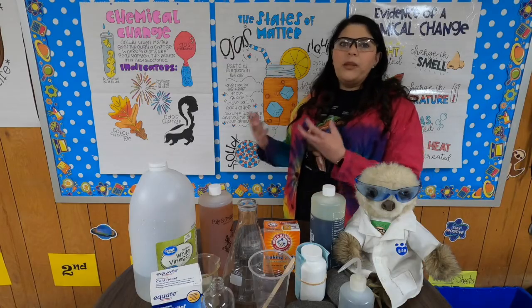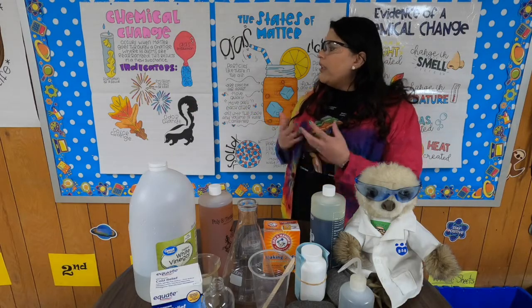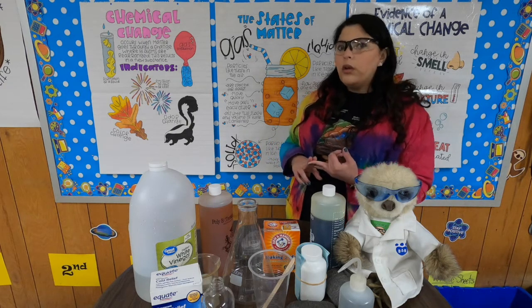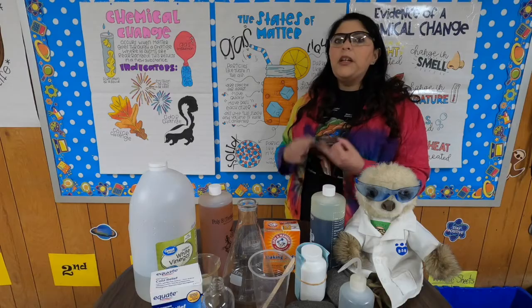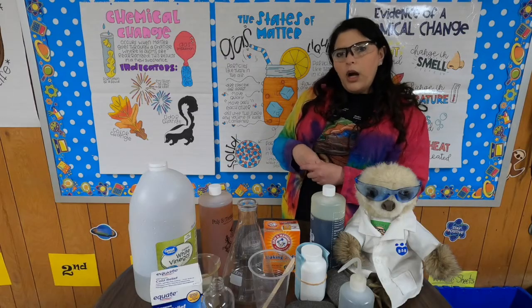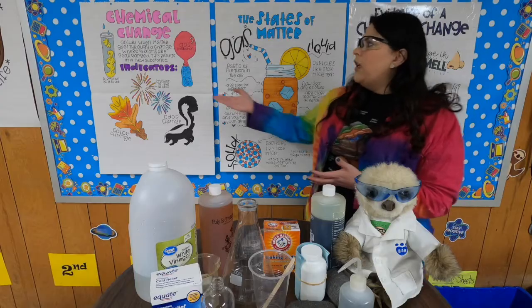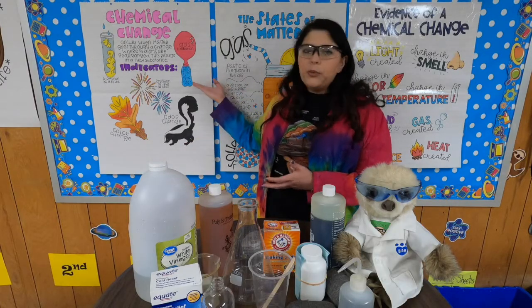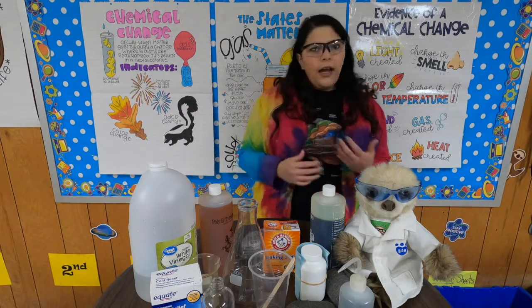And we can look at different bits of evidence to show that something is a chemical change. That's what I have over here. We have indicators like an unexpected color change, an unexpected temperature change. Something gets cold or hot unexpectedly. Not like I put it on the stove and now it's hot, that's expected. It has to be an unexpected temperature change or an unexpected color change. If I put food coloring in water, that's still the original substances. It was an expected change. Formation of a solid, which is a precipitate, that's evidence of a chemical change. Gas production, where there's a gas there that wasn't there before, that's a chemical change.